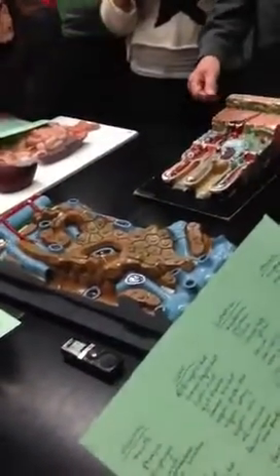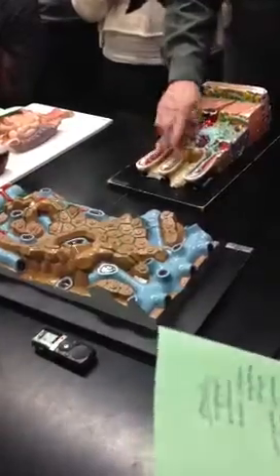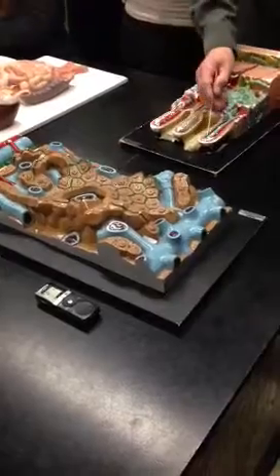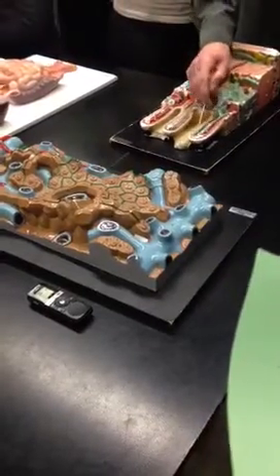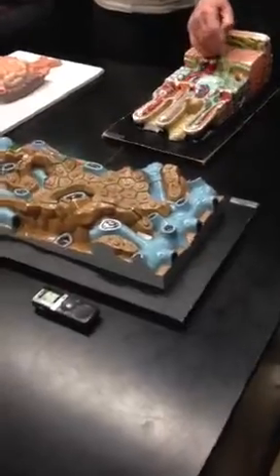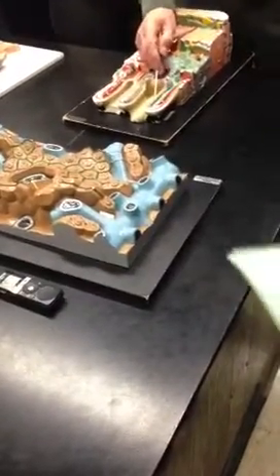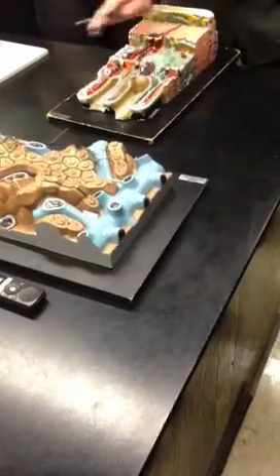So now, here is the lumen of the intestine. The food is sliding along over here. Okay. We have these finger-like projections coming up from the mucosa. These are called villi. So each one of these things is a villus. In the middle of a villus is a lacteal. This green thing that you see here, that's a lacteal, and all of these green things are filled with lymph. The lacteal absorbs fats, fatty acids, glycerol, cholesterol. Any fats that are going to be absorbed from the gut are going to enter the lacteal, not the blood.